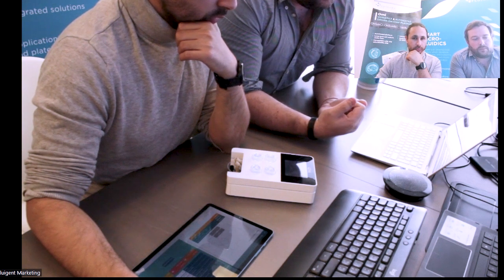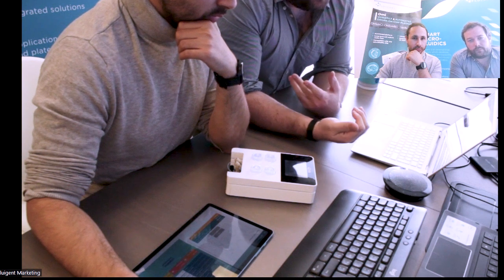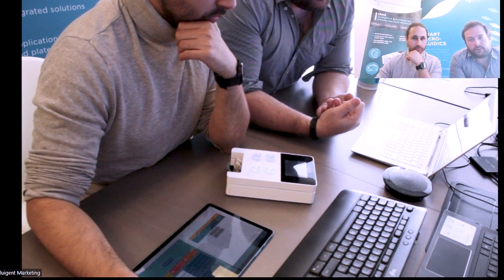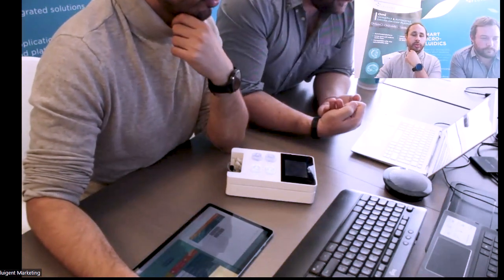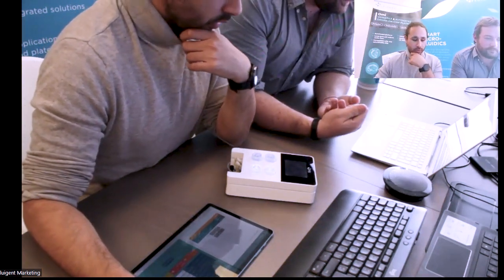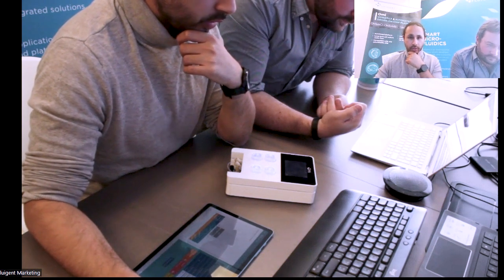So it's more meant to be used like a consumable and maybe to be cleaned with a cleaning solution. Autoclave might be a bit harsh. We do not attest that you will have the same performances if you autoclave it and clean it. So we are proposing the cartridge as a consumable.